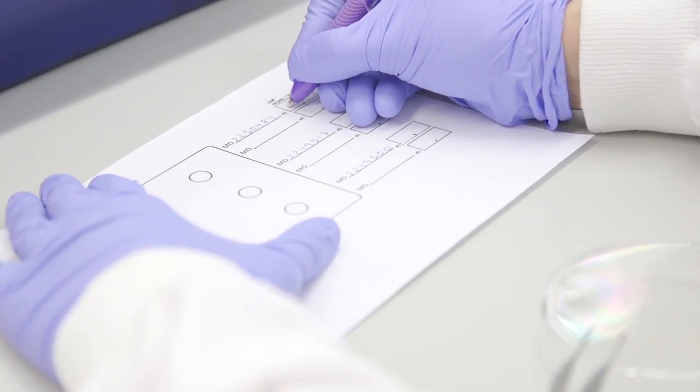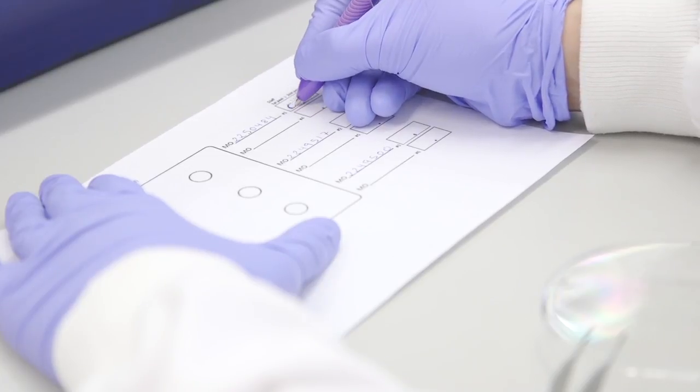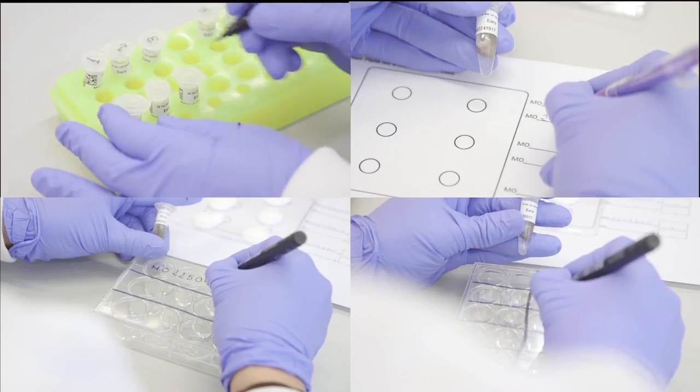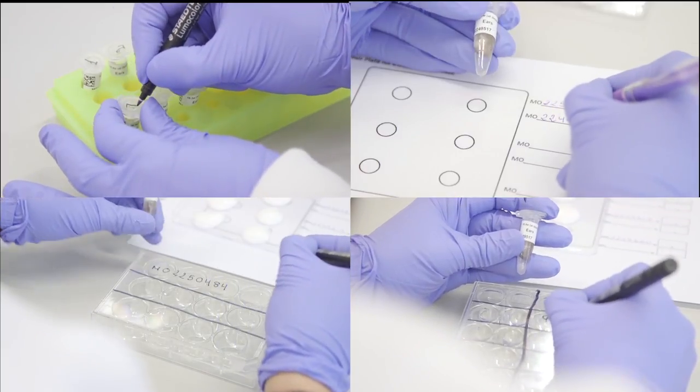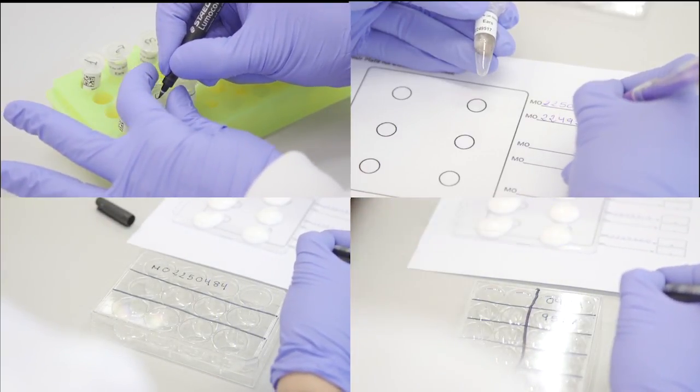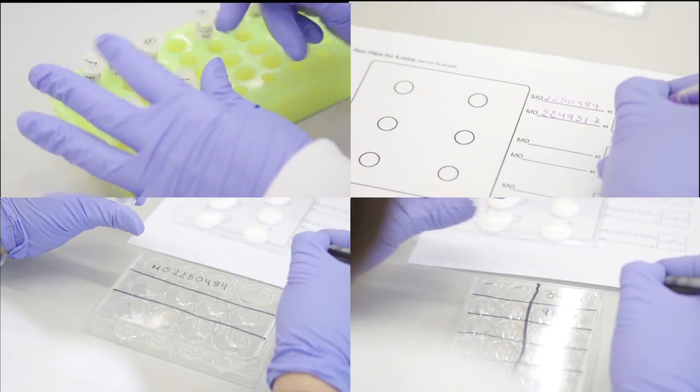In addition, after each peel, your signature should be added to each sample listed on the sheet. This labeling is crucial to ensure that no samples are mixed up, allowing us to accurately track the samples throughout the entire process.